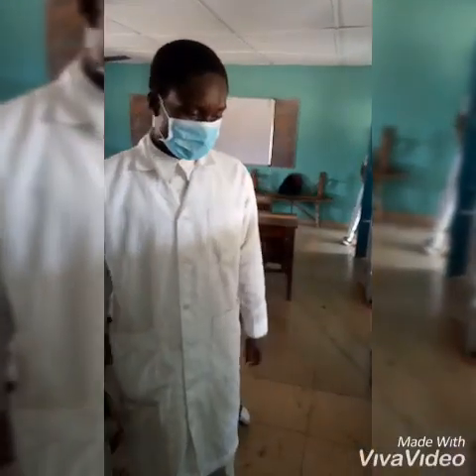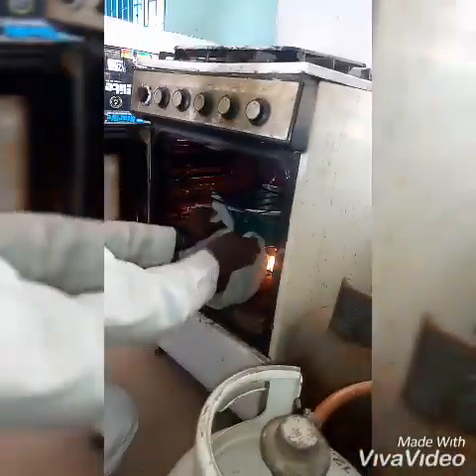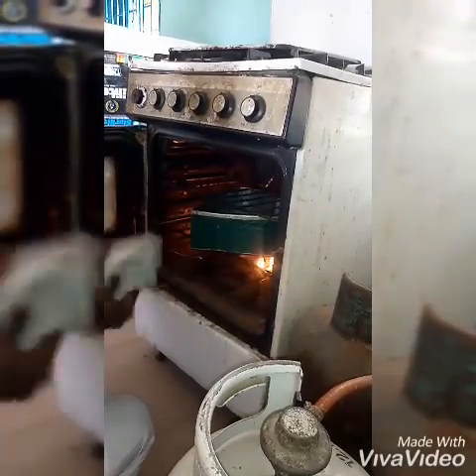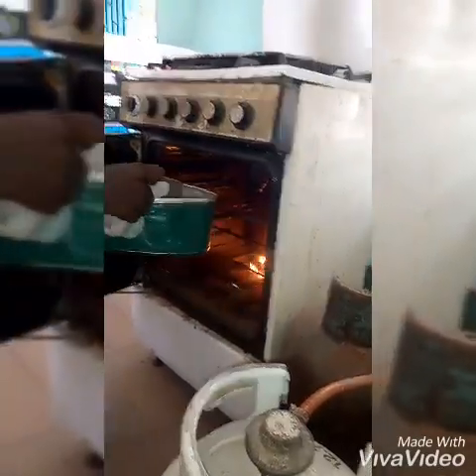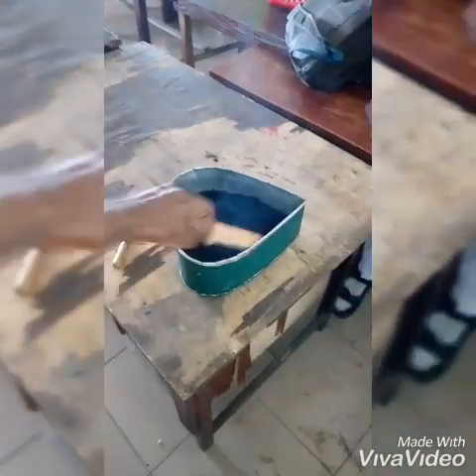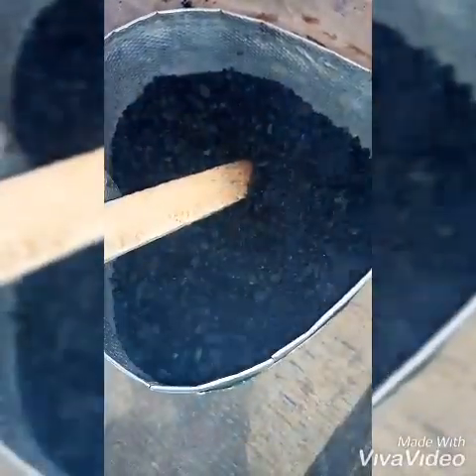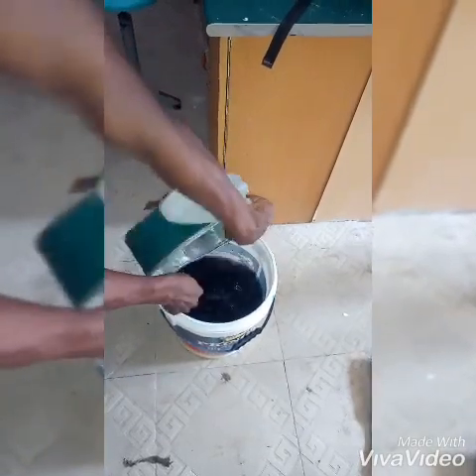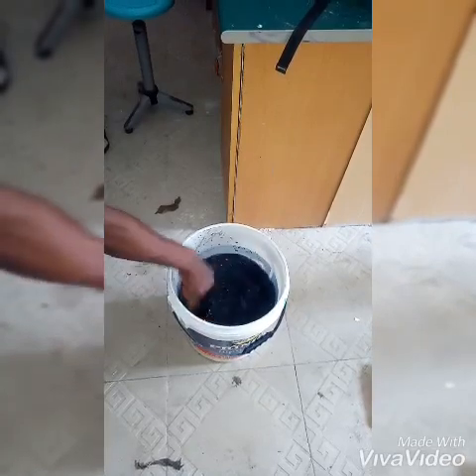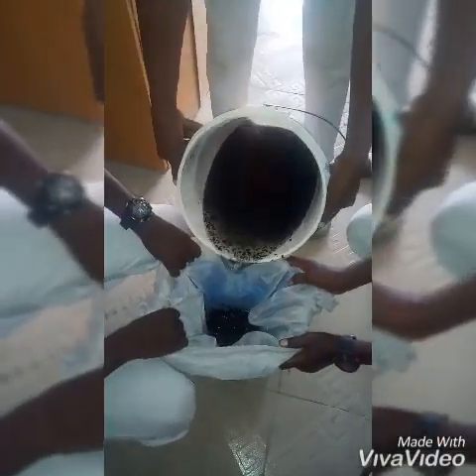It's about one hour 30 minutes now. We are about to remove our activated carbon. Now it's well activated, but we have to wash it with water to remove the residue of acid — we need to wash out the remaining acid.